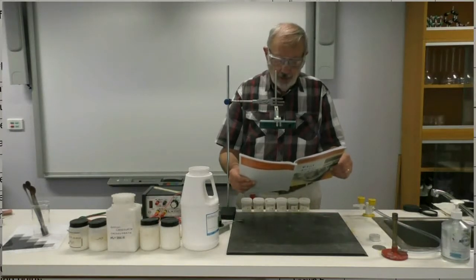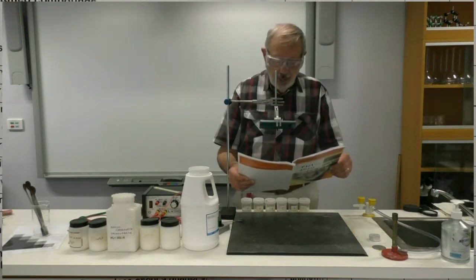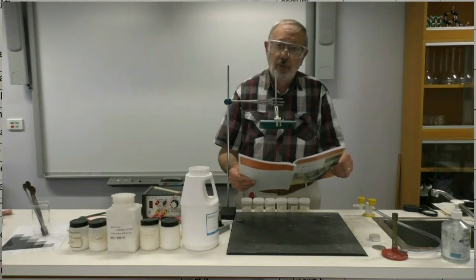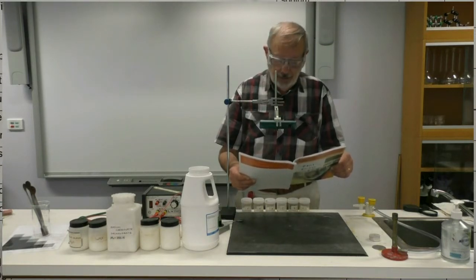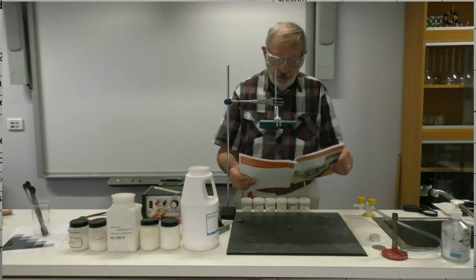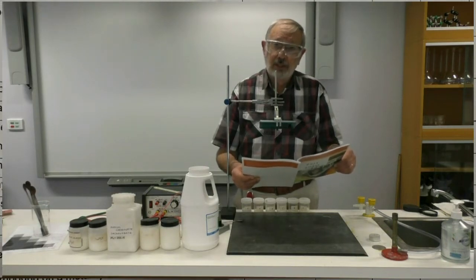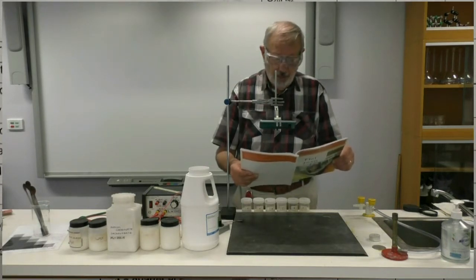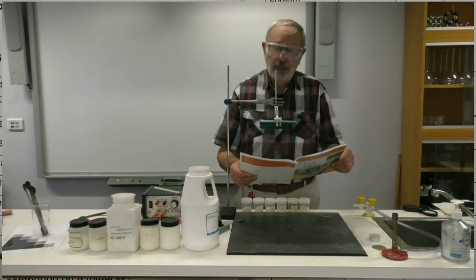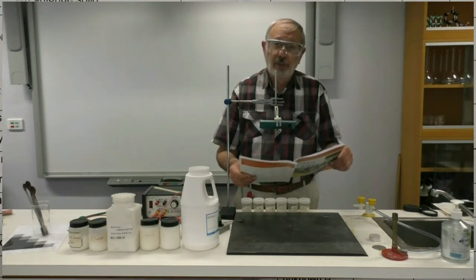With the sodium carbonate decahydrate, we saw the crystals dissolve first of all, then release their water and form simply sodium carbonate. So its behaviour on heating is simply to release the water. With the wax, we did not put that into the Bunsen burner, so I'll just give that a try. We'll see what happens.